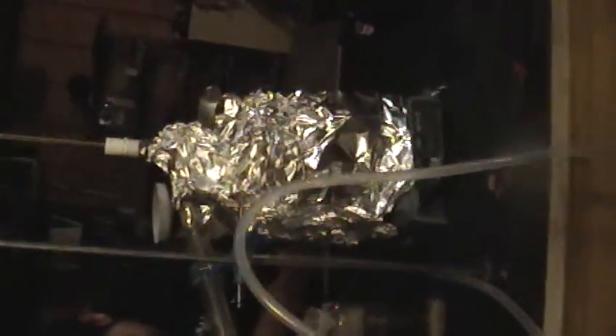As you can see, all of the boiling side has been wrapped in aluminum in a couple of layers. There's Ryan taking photographs.